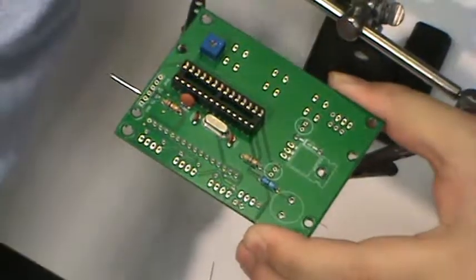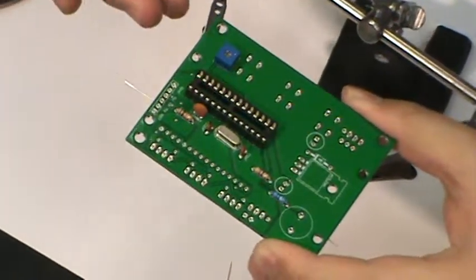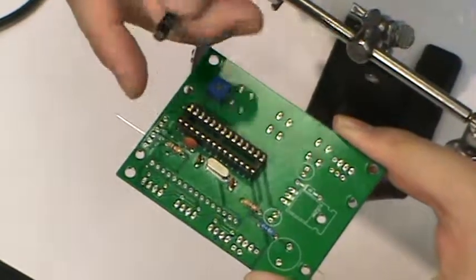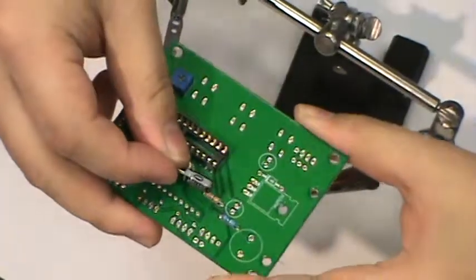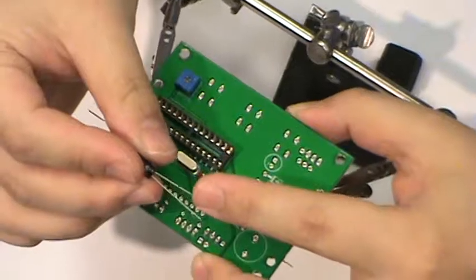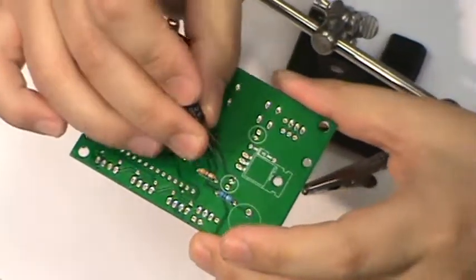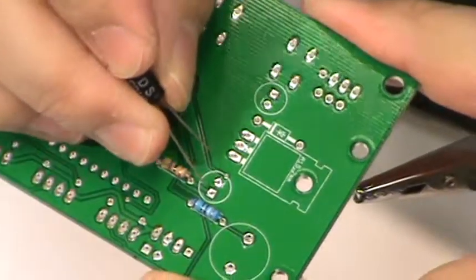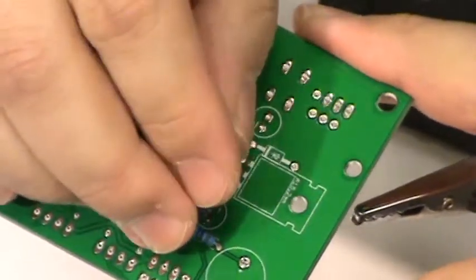And let's go with the capacitor. This capacitor actually has polarity. These other capacitors, they don't have polarities. They're just like parallel plates. And this one is actually electrolytic, so it does have a polarity. You can see there's actually a stripe here that says negative pin, which is a shorter pin. So shorter is negative, this longer is positive. And you look at the silk screen. Silk screen actually has a negative right here. So we'll just drop the positive on the other side, negative on this side.